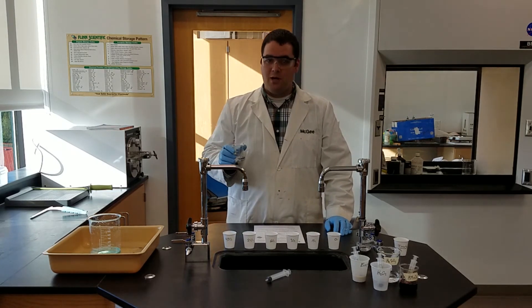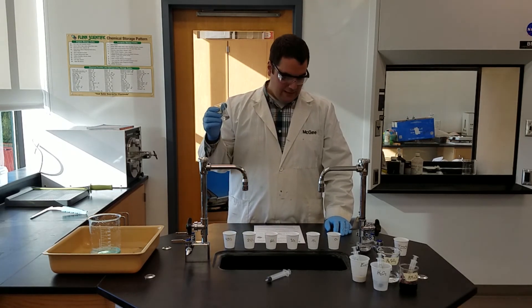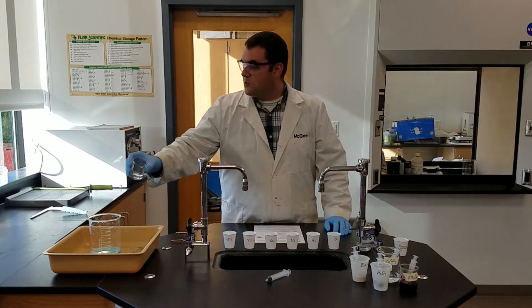And of course, properly dispose your chemicals in the right place. I think this is where it goes.